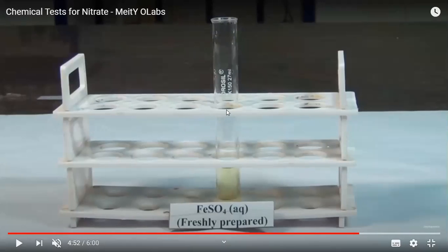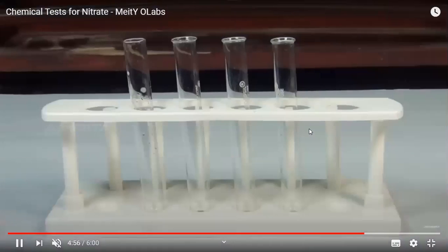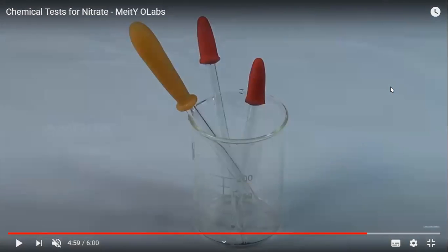This freshly prepared FeSO4 solution is slightly green in color. Then we need concentrated sulfuric acid, various test tubes for performing the tests, and droppers to add things dropwise.